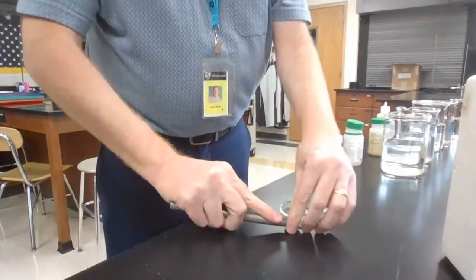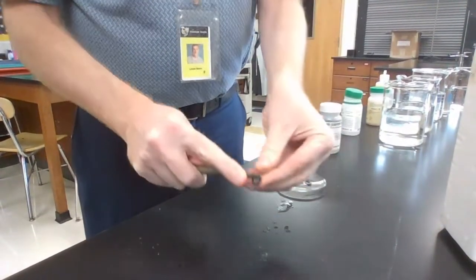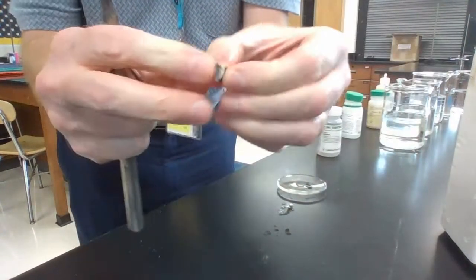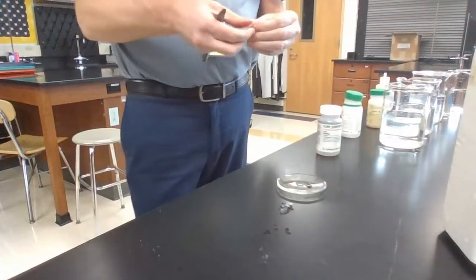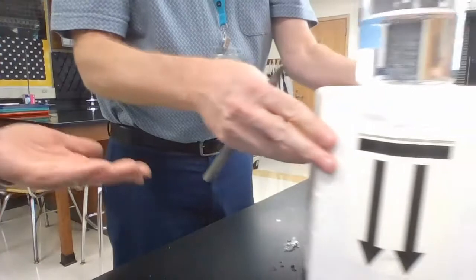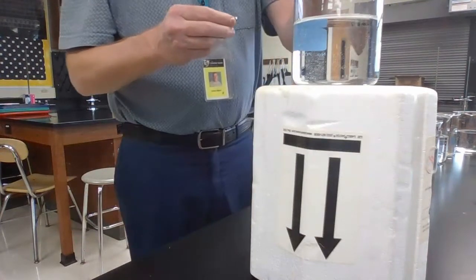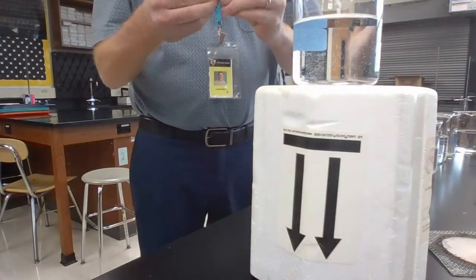When I cut this, I'm just using a regular scoopula. It's kind of like butter right out of the fridge, a little bit stiff. But what's neat is if you look at the inside, you see how shiny it is? The outside is all black, but the inside is nice and shiny. Isn't that a characteristic of a metal? Yes, metals are shiny and malleable, which is exactly what you just showed us, because you were able to cut that with just the blunt edge of that scoopula. They're soft, and they're also good conductors of electricity and heat.